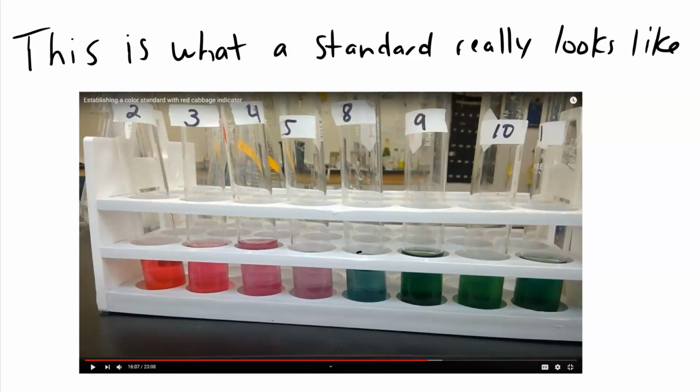So as you can see from this standard, pH of 8 is sort of like a turquoise green, 9 is a darker green, 10 is a lighter green, and what's not shown here is as you get into 12, 13, 14, it turns into a yellow.